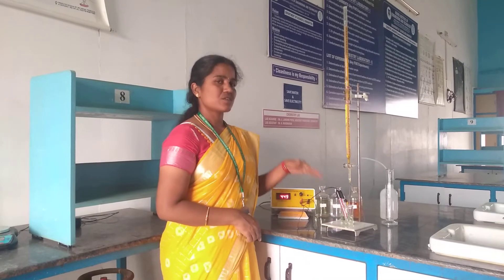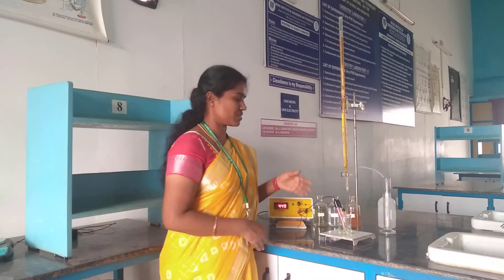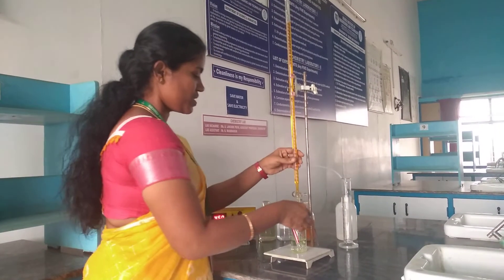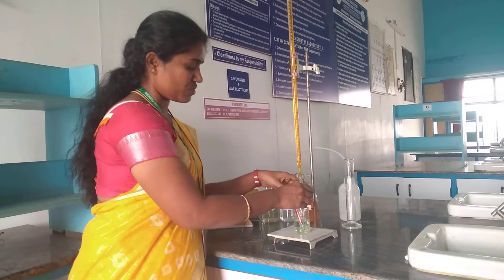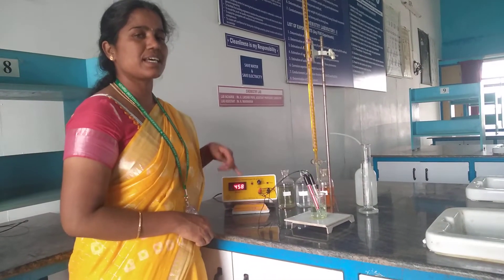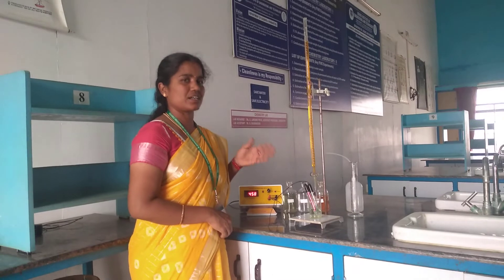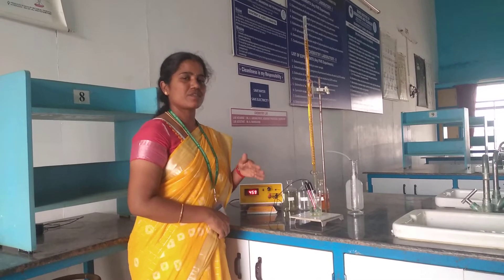By adding the reagent, the potential difference is created. Slowly the Fe²⁺ is converted into Fe³⁺ — a reduction-oxidation reaction is taking place. By adding 1 ml we need to stir the solution thoroughly, then only we will get the correct value. The second value was 0.458 volts. The EMF is increasing because Fe²⁺ is converted into Fe³⁺. Likewise we need to take 20 to 25 readings up to the end point, which is the sudden removal of Fe²⁺ as all ions are converted into Fe³⁺.